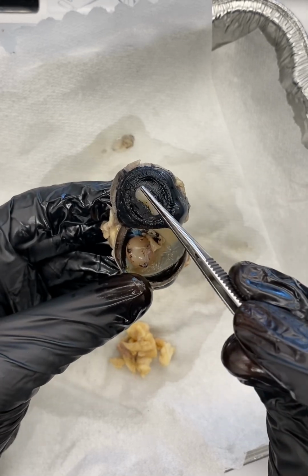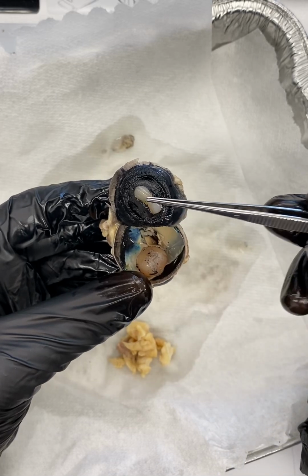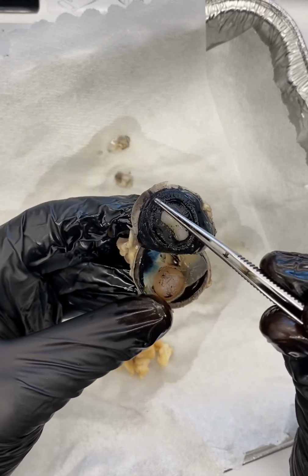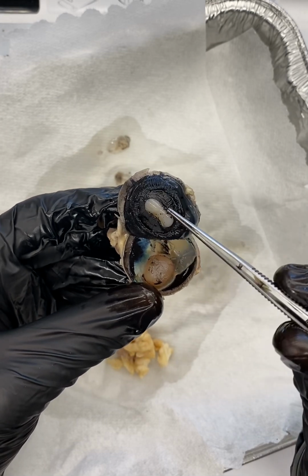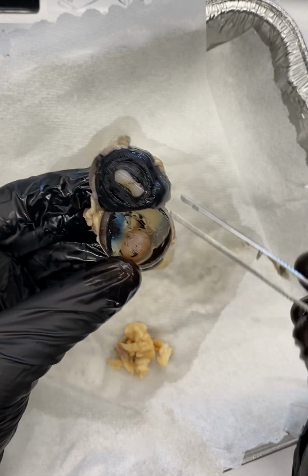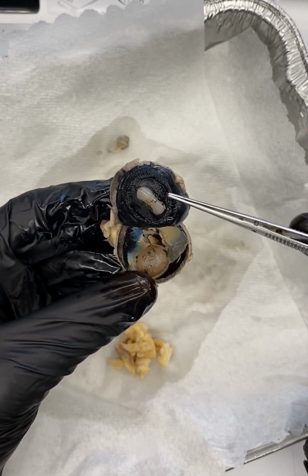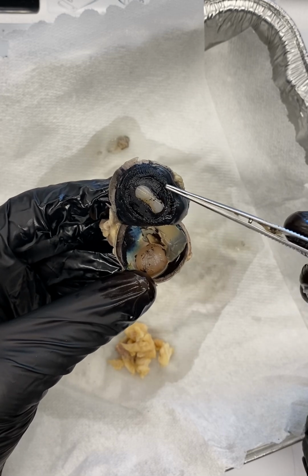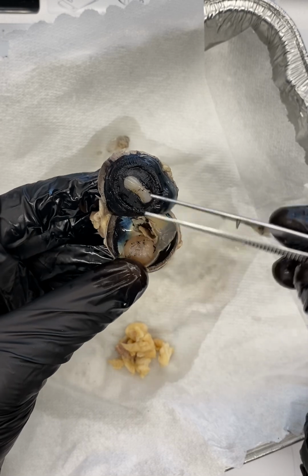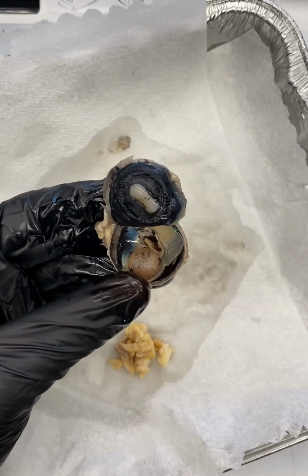But just as a review, right? Again, pupil here, lens here, which again would be sitting in front. It's being held in place by that vitreous body or humor. You have our ciliary body. There are ciliary processes that come off of those, and extending from those are zonular fibers, which radiate and attach to the lens. And again, when that ciliary muscle contracts, it pulls on the zonular fibers or suspensory ligaments, changes the shape of the lens, and allows for either distance or near vision, right?